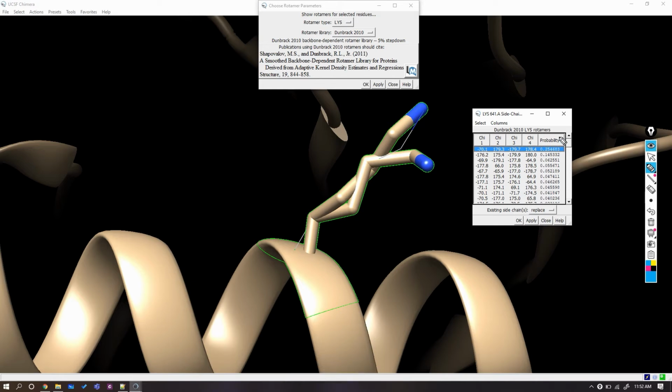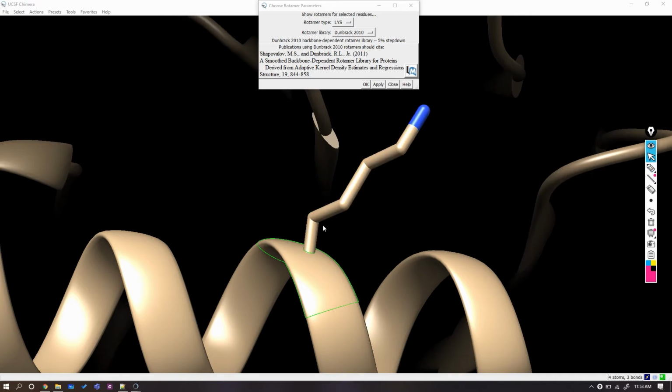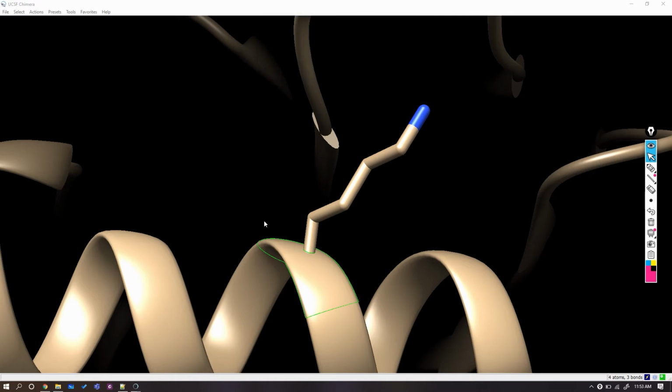Let's select the first again based on the probability, which is 0.25 here. It is not good but better than others. Here select the option of replace before you click OK. After clicking, you can see that one rotamer is replaced instead of the two which were originally present in the PDB file.